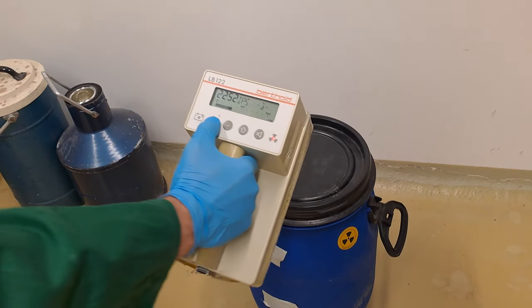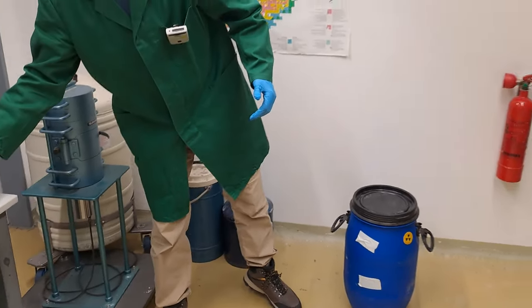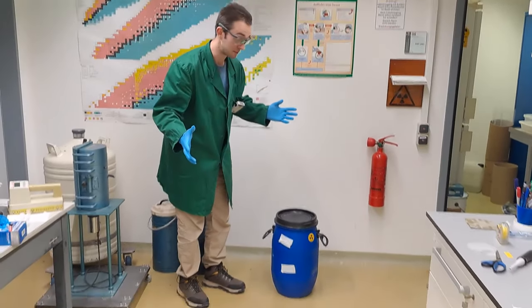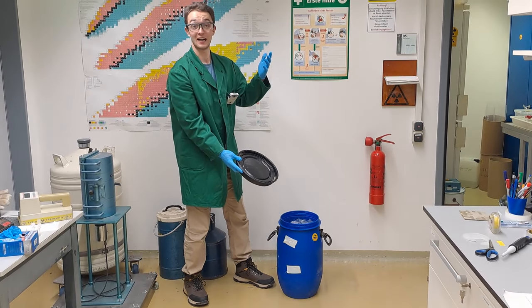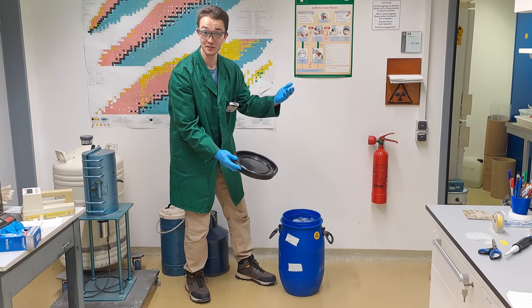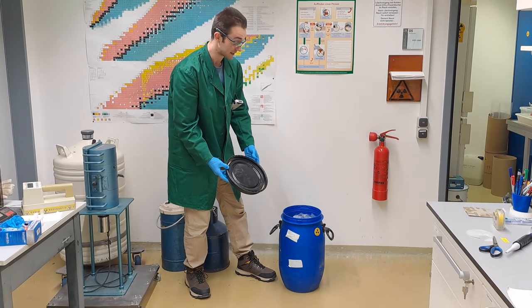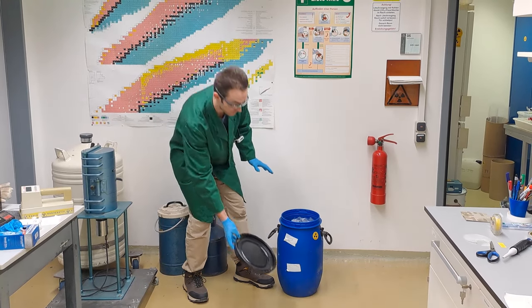Now I need to get some uranium minerals out of it, so I have to open it and when I open this barrel, there will be a quite significant amount of radon released into the laboratory. Yeah, there is no other way to get the uranium out of it other than just opening it up.